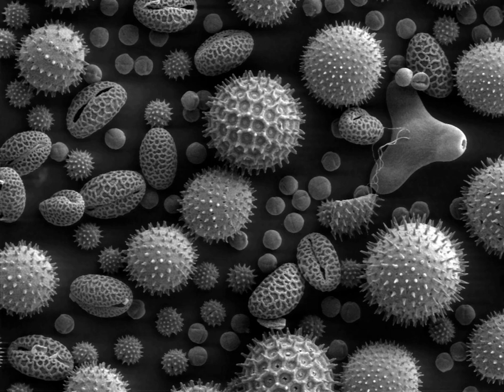The SEM has compensating advantages, though, including the ability to image a comparatively large area of the specimen, the ability to image bulk materials, and the variety of analytical modes available for measuring the composition and properties of the specimen. Depending on the instrument, the resolution can fall somewhere between less than 1 nm and 20 nm. As of 2009, the world's highest resolution conventional SEM can reach a point resolution of 0.4 nm using a secondary electron detector.